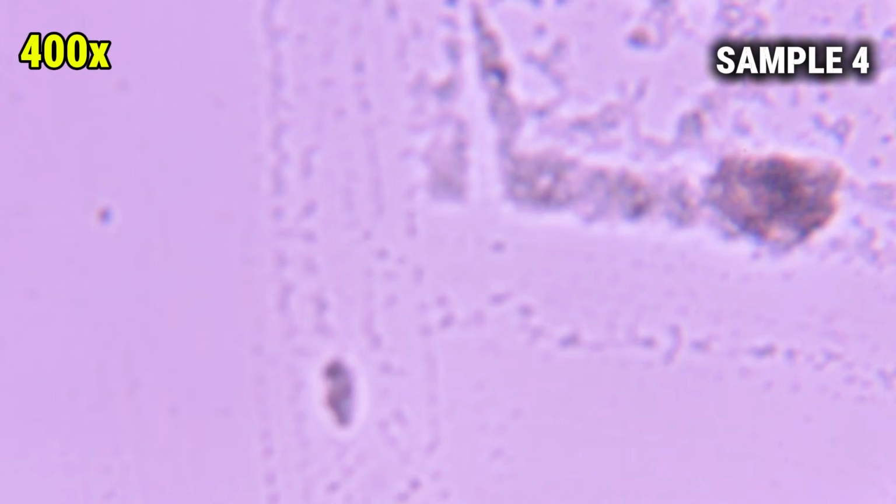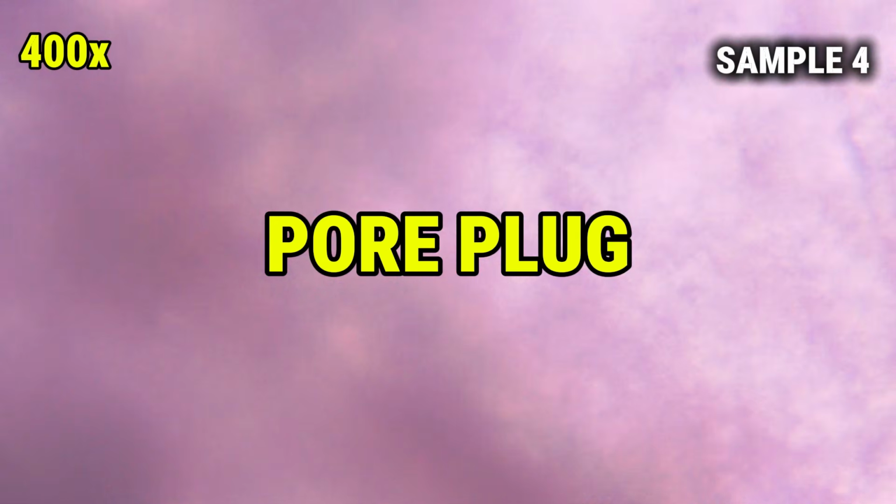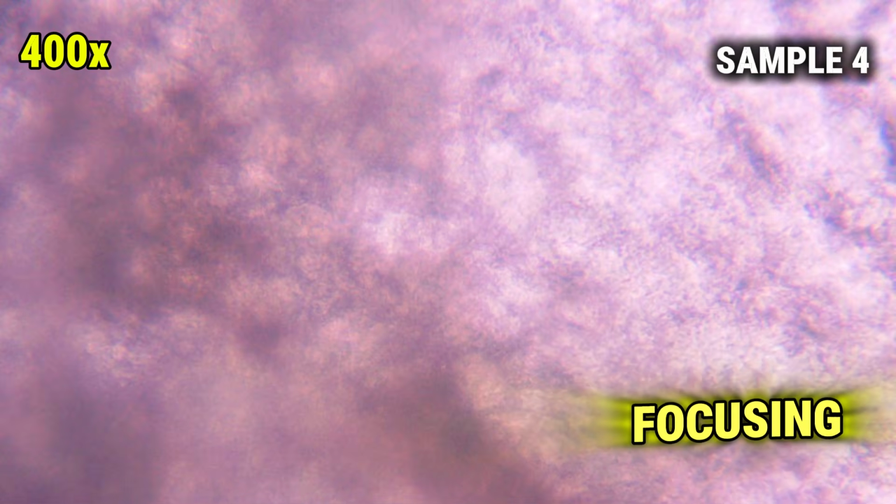Once the plug is removed, I can't believe I'm doing this, and spread across the slide like butter. Yeah, like butter. At higher magnification, you can start to see this uneven texture along the strand where bits of oil and skin debris are clumped together. So what we're seeing here is essentially a microscopic piece of pore plug, magnified enough that we can observe the fine structure of the material that normally sits inside a single pore on the nose, which is pretty fascinating.